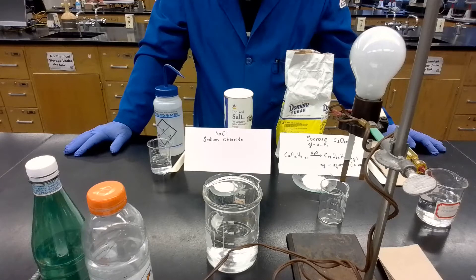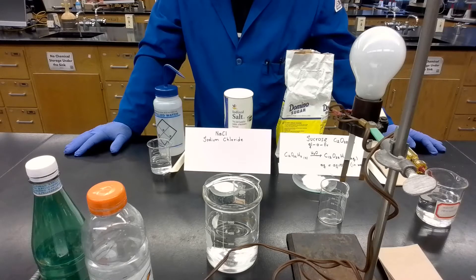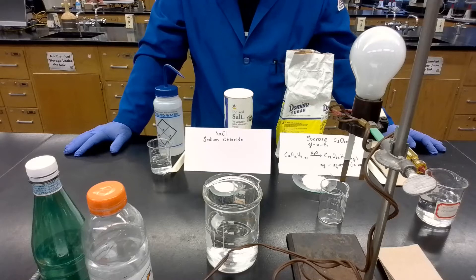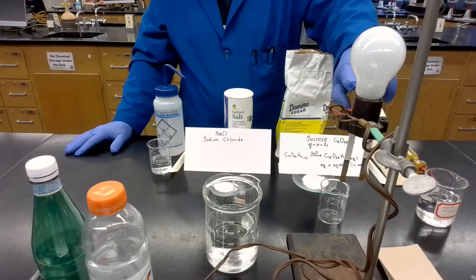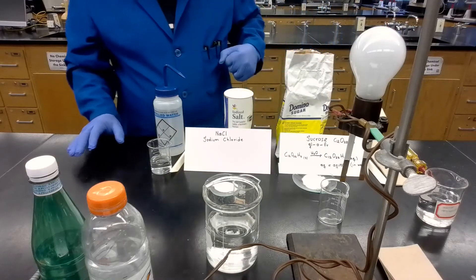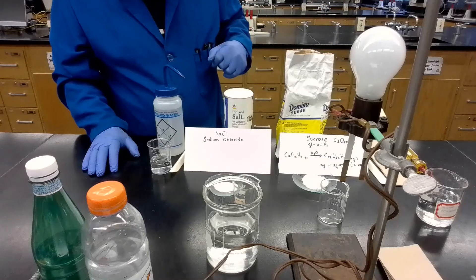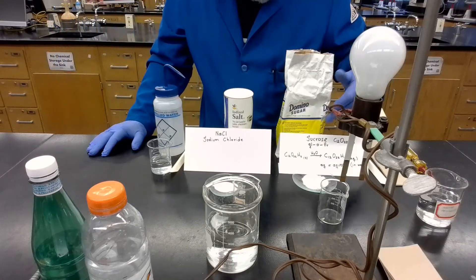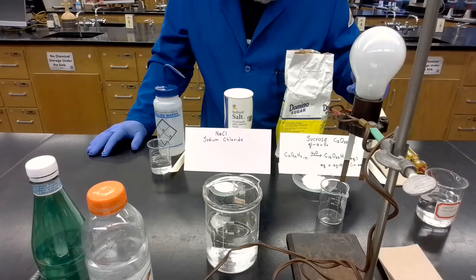The objective is to distinguish between electrolytes and non-electrolytes using a simple circuit like this. We are going to test two different solutions today. One solution contains sugar — that's the regular table sugar.